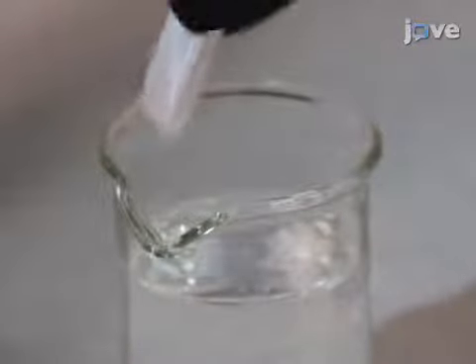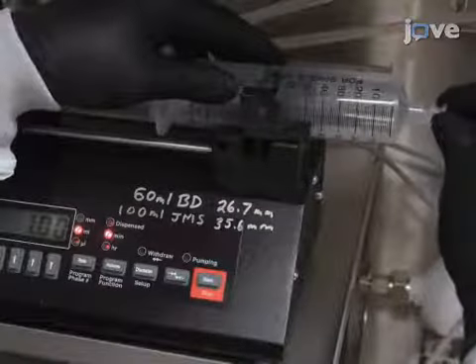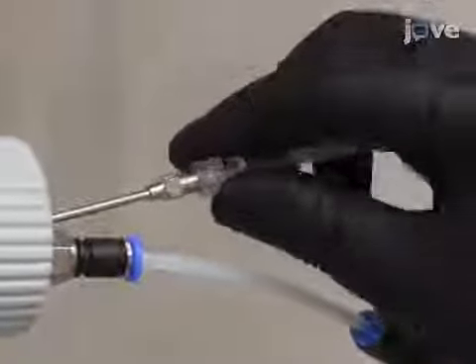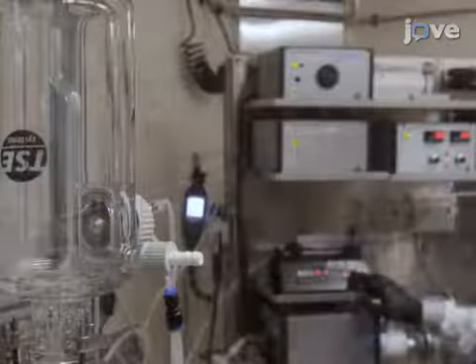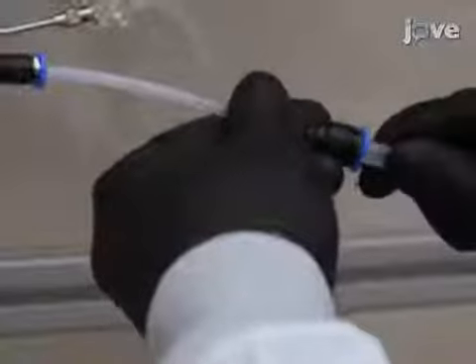To generate a nebulized liquid aerosol, dissolve the drug of interest in 100 milliliters of water and load a 100 milliliter syringe with the resulting drug solution. Place the syringe into a syringe pump with the flow rate set at 1 milliliter per minute and connect the pump to the jet nebulizer. Purge the air from the feed line leading to the nebulizer and connect the pressurized air source to the jet nebulizer. Then set the airflow meter to 10 liters per minute with the jet nebulizer installed into the pre-separator, which connects the nebulizer to the central aerosol plenum of the inhalation unit.